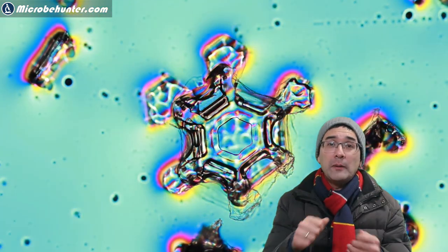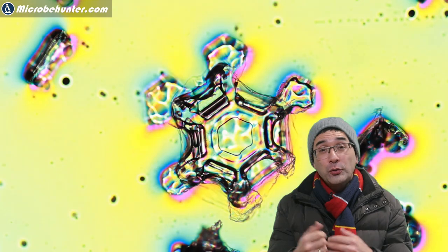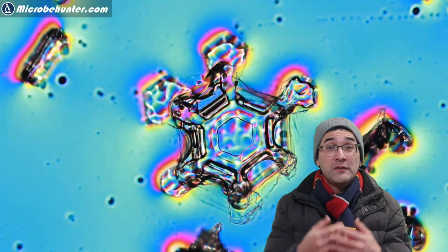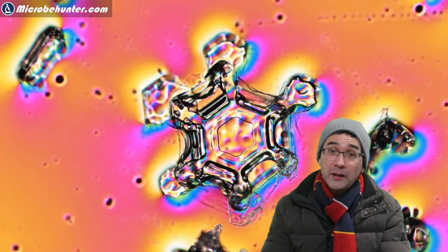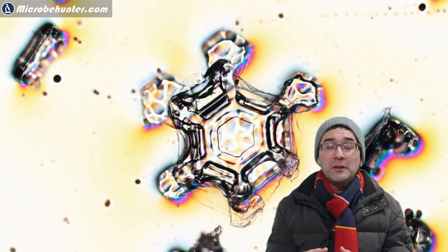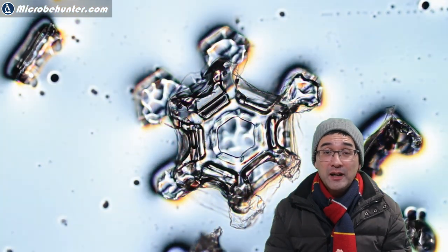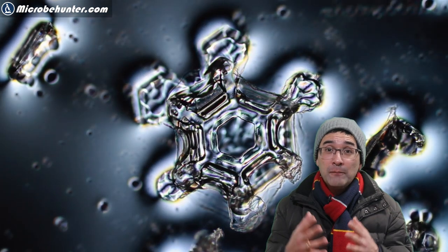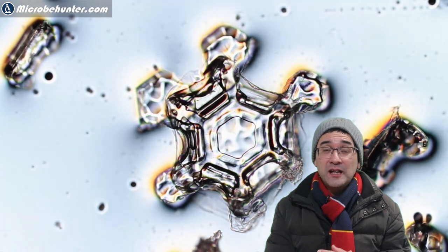Or you can also try to apply a very thin layer, but of course you have to get the right compromise here because if it's too thin then it's going to dry very quickly as well. So a little bit of experimentation always works and as a matter of fact I made several slides to find a few of those nice structures.